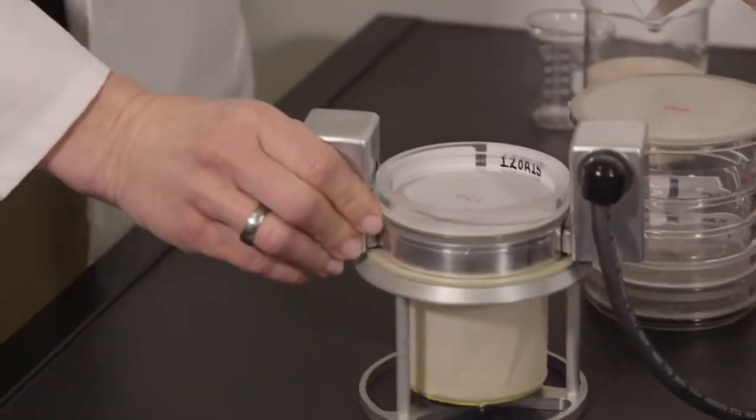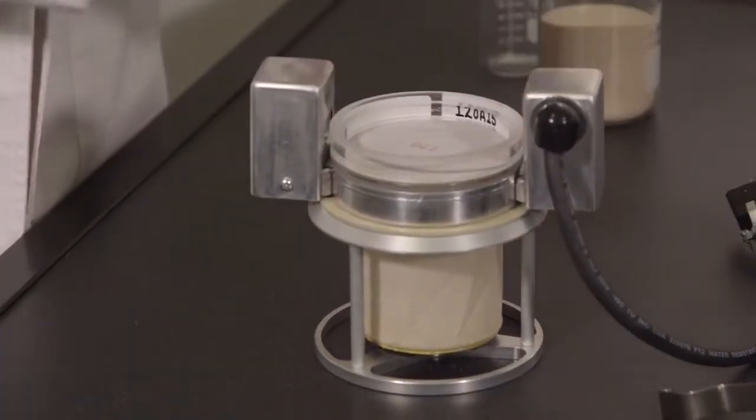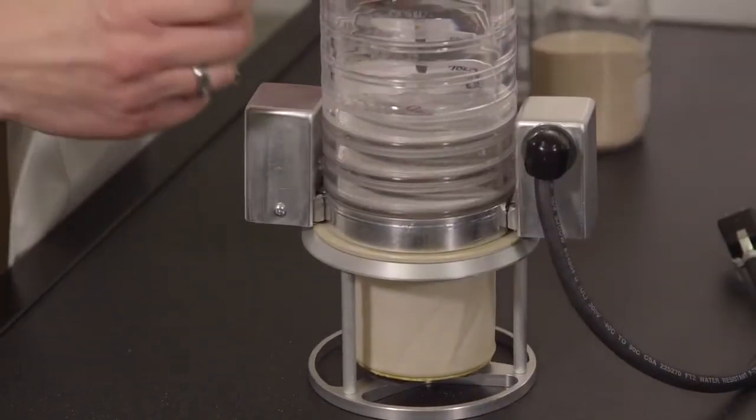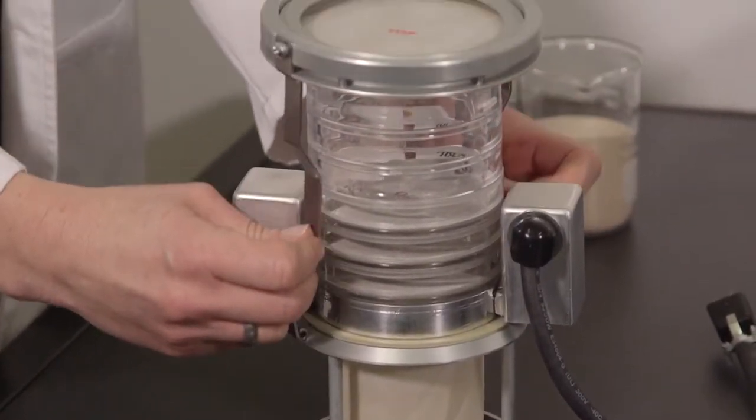Complete your test stack with incrementally coarser sieves toward the top. Add spacers as needed, followed by the top cone, your sample, and the diaphragm.